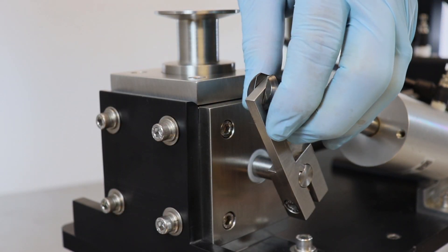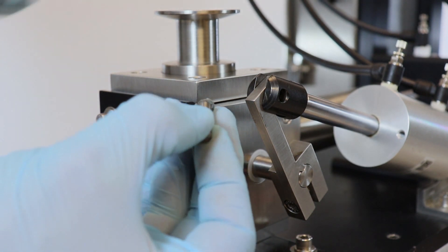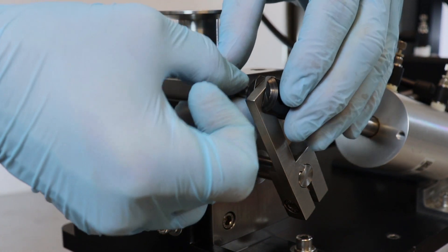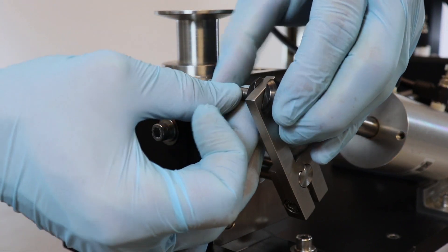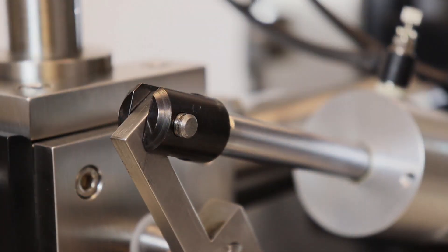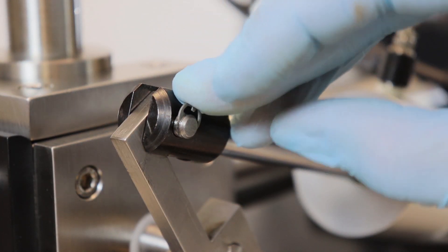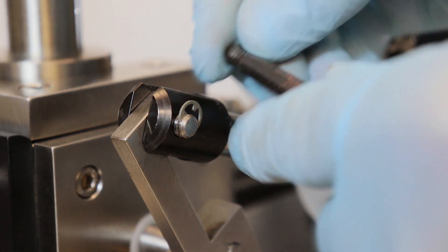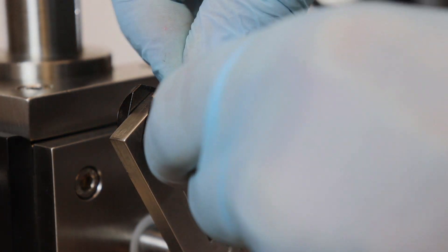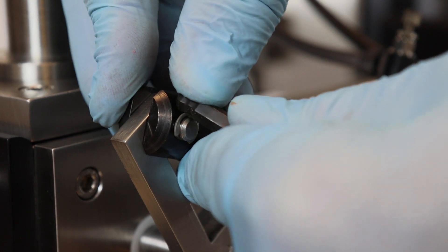Connect the rotary cylinder to the rotary arm with a pin. Pre-attach a C-clip to the pin and insert it from the block assembly side of the rotary arm. To secure the position of the pin, insert a second C-clip into the groove of the pin. Because the C-clip may be stubborn, use the end of an Allen wrench or standard screwdriver to persuade the clip into position.